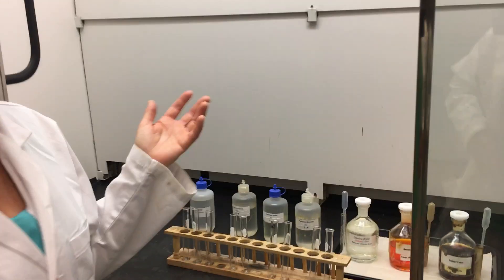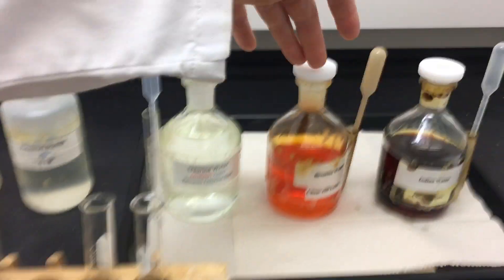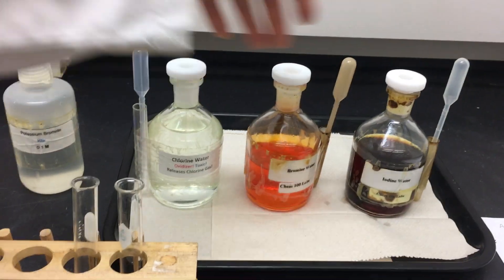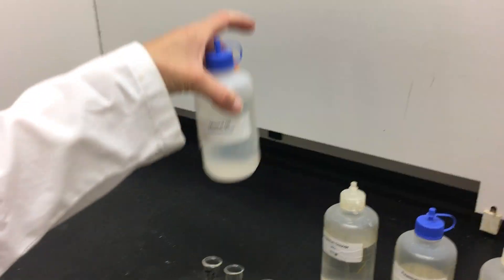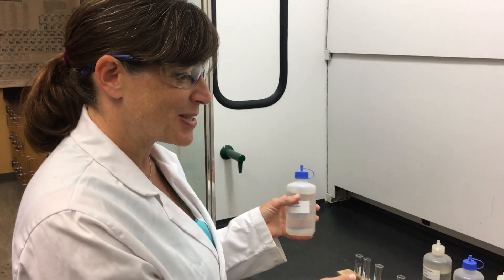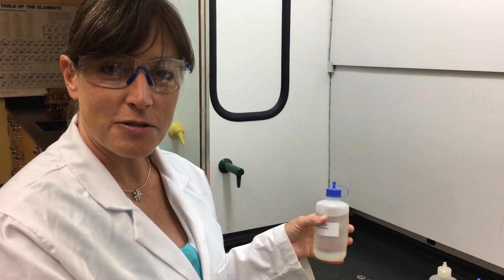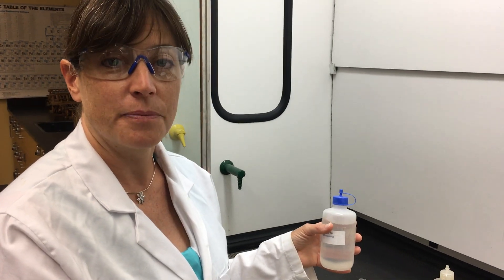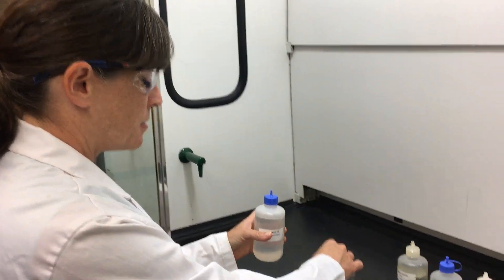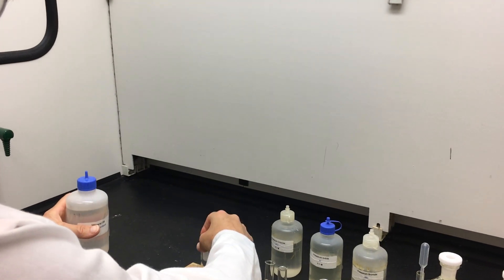One of the properties of halogens is they have unique colors. In the first part of the experiment, we have chlorine water, bromine water, and iodine water — our halogens mixed with water. Halogens are also soluble in mineral oil, so we're going to add mineral oil to each of our test tubes and then add the corresponding halogen water to see what characteristic color each turns. We're adding about one milliliter of mineral oil.